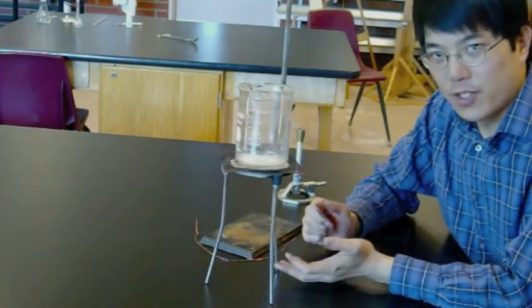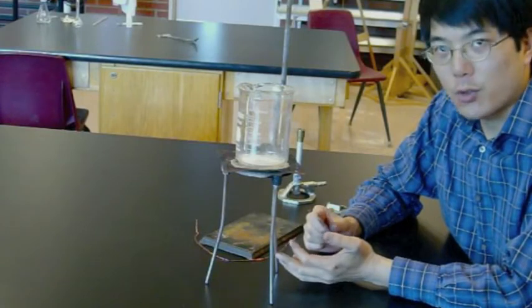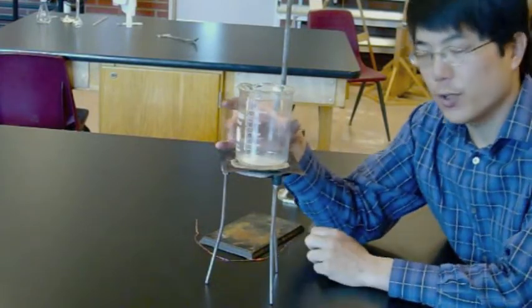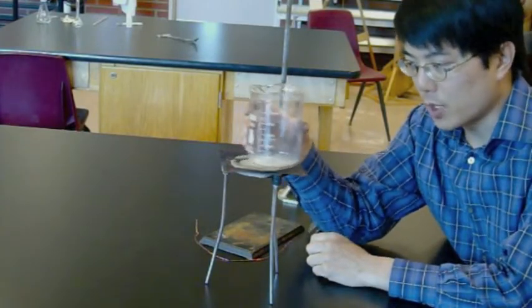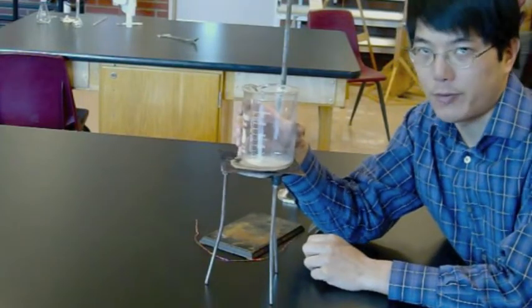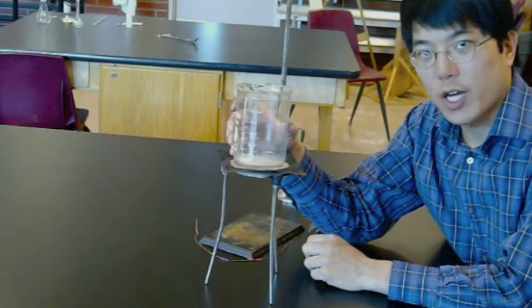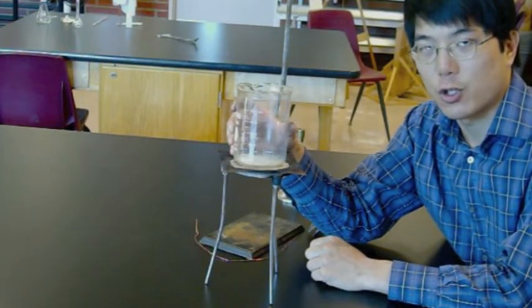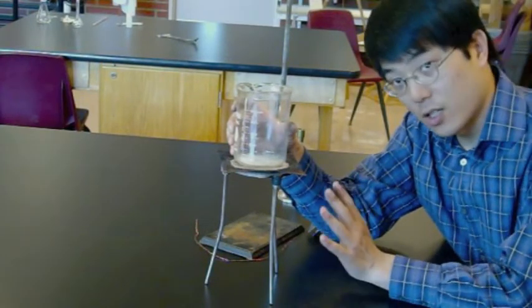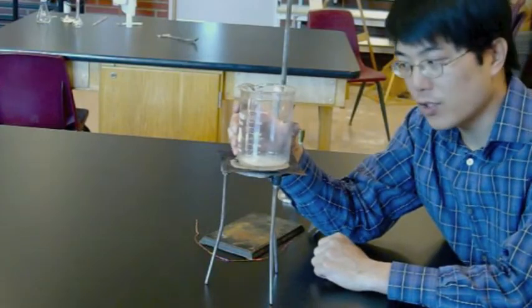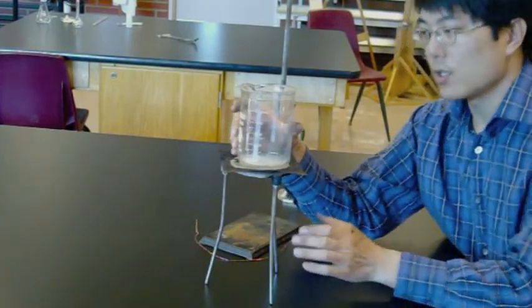This is the fundamental basics of your hot water bath, but there's a problem. When we fill this with water, it will become slippery and top heavy. And if the beaker tips over, you're going to have boiling hot water and glass shards flying all over the place. It's not a real safe situation. So we need some way to stabilize the beaker.